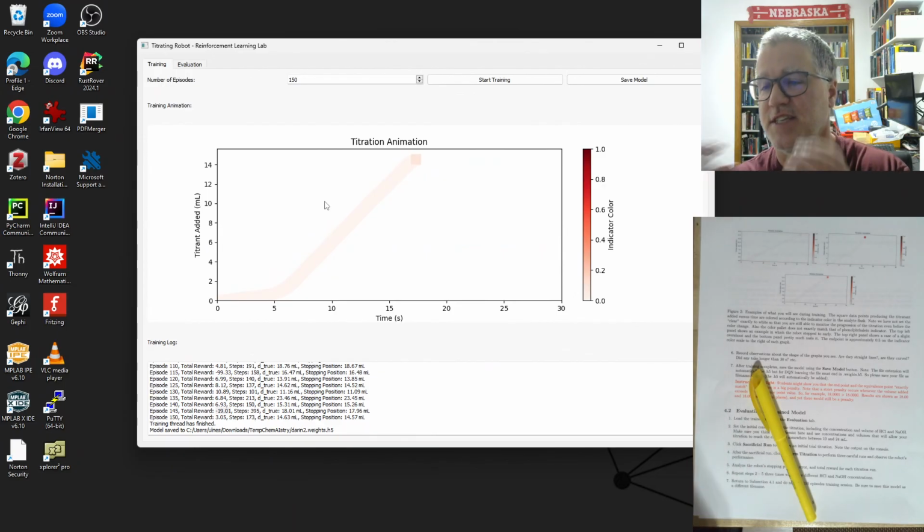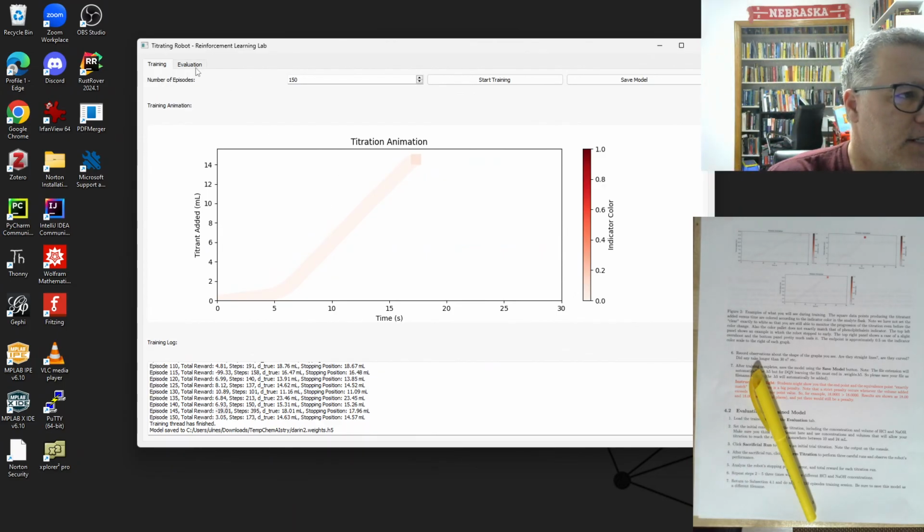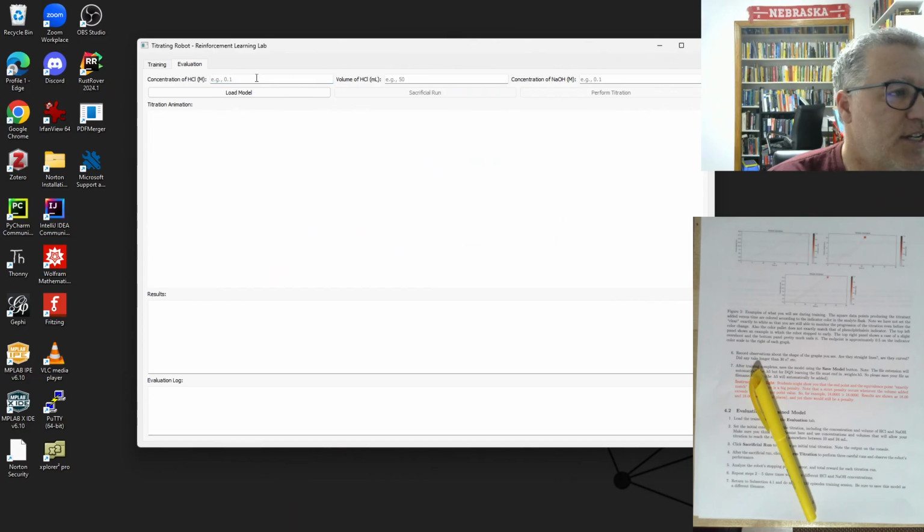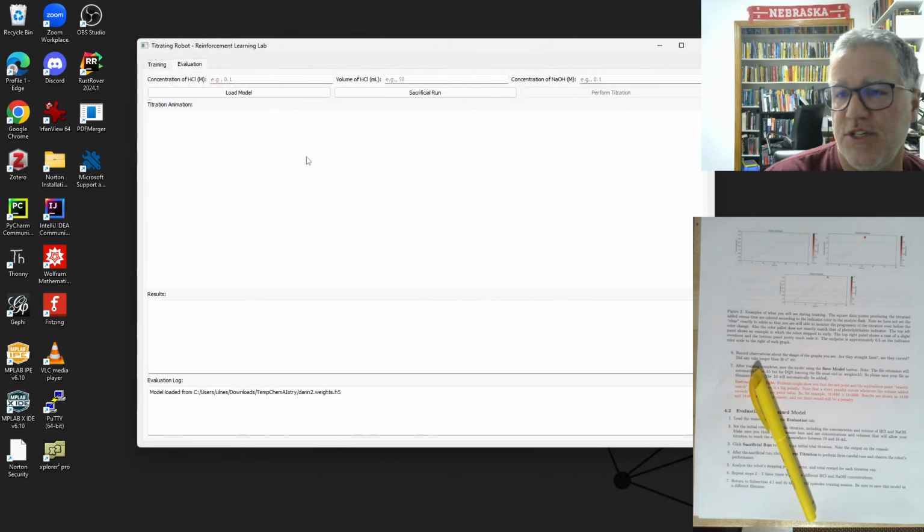So let's give it an unknown and have it determine this. Maybe your instructor will give you specific values here, but let's just put some in. Let me load the model. I'm going to load Darren 2 weights here. That's what we just trained on. And I'm going to go 0.10, let's see, 0.1110 as a concentration of our HCl. We've got, let's say, 16.05 milliliters, and our concentration of our sodium hydroxide is going to be 0.1001.